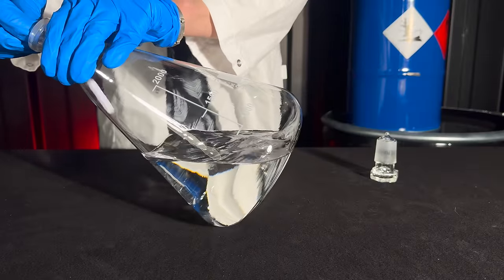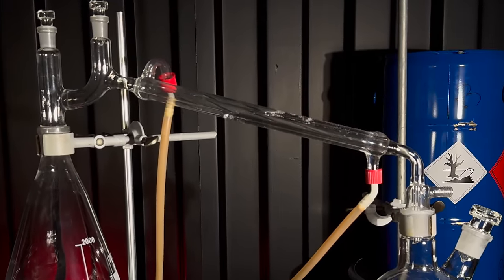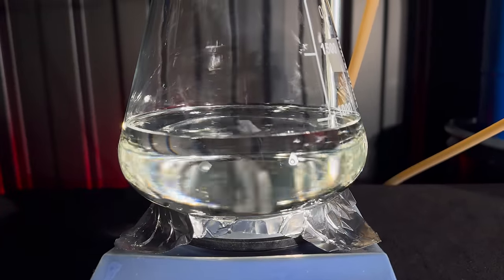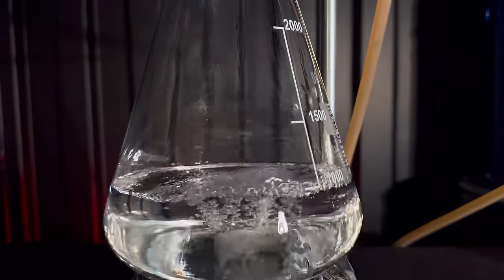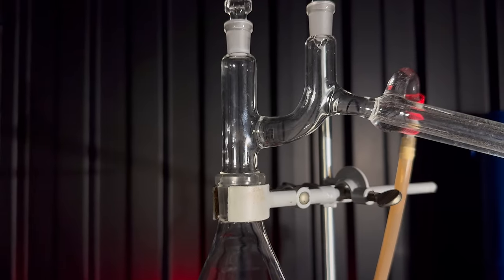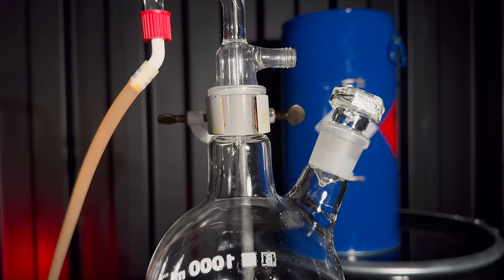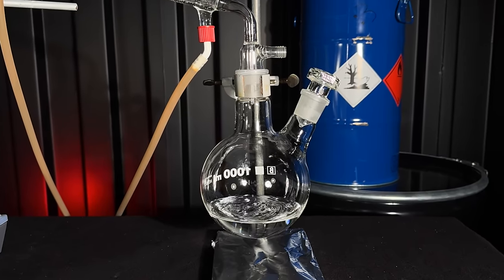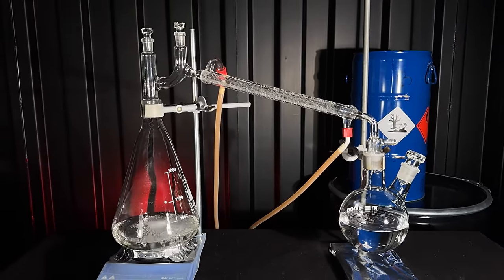Acetone has a low boiling point of only 56 degrees Celsius. I can thus easily distill it off with a simple distillation. I always enjoy watching the vapor front climbing up the glass and seeing the first drops dribbling into the flask. The entire distillation took less than an hour and left us with a solid mass of white product.